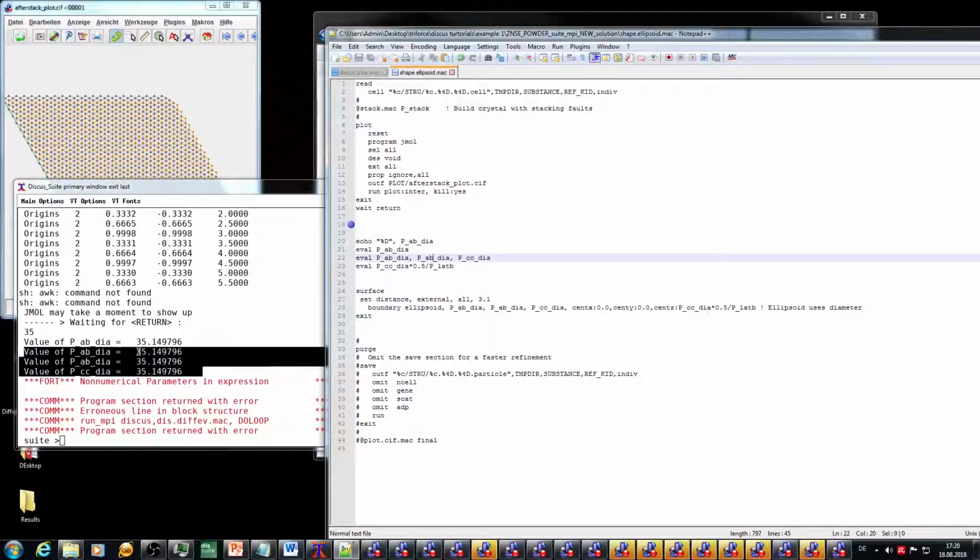So in the end, we create here with the boundary command a sphere. However, the evaluation of this line is not printed out, meaning that here there's an error. However, we know that the diameter is totally fine. It's 3.5 nanometers. That's a simple calculation, and so the P lattice parameter B needs to be wrong. So that stands for a parameter, lattice parameter B.